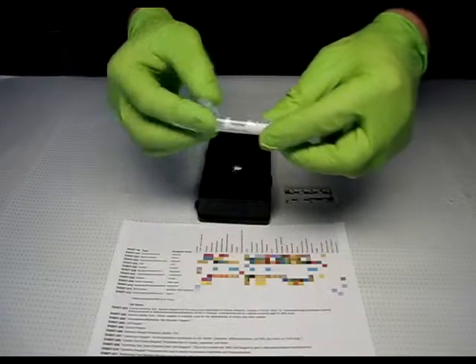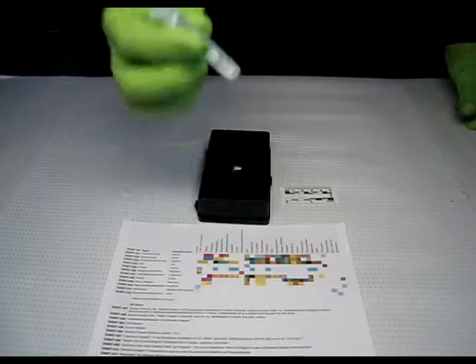Squeeze to break the ampule inside, expelling the liquid to the tip of the sampler.